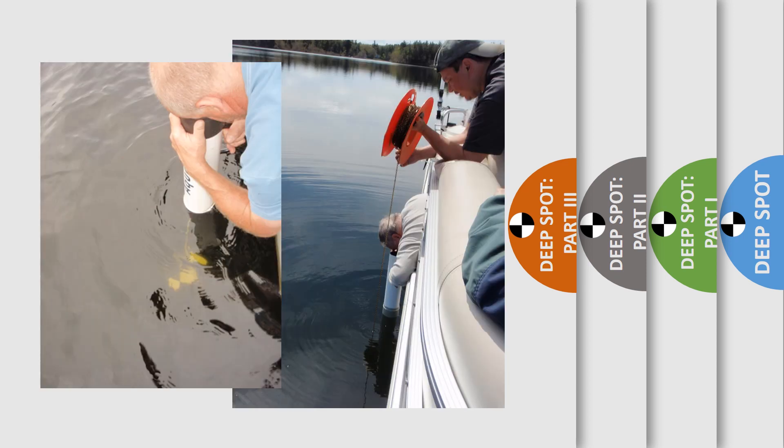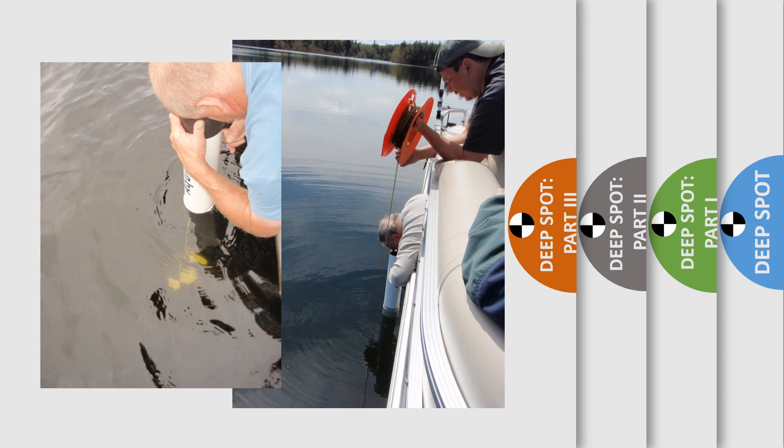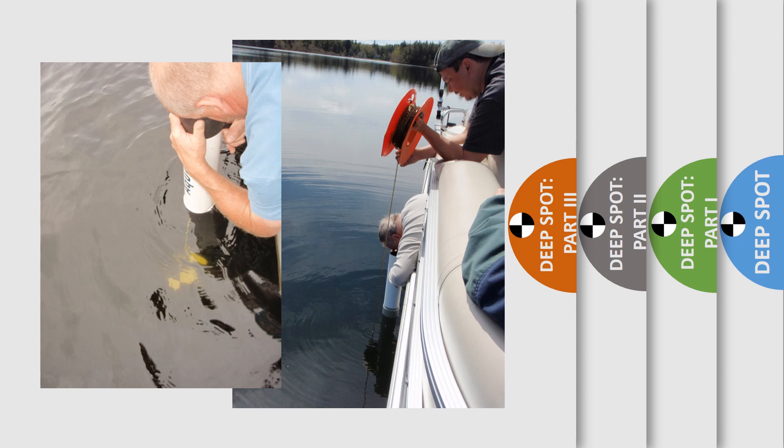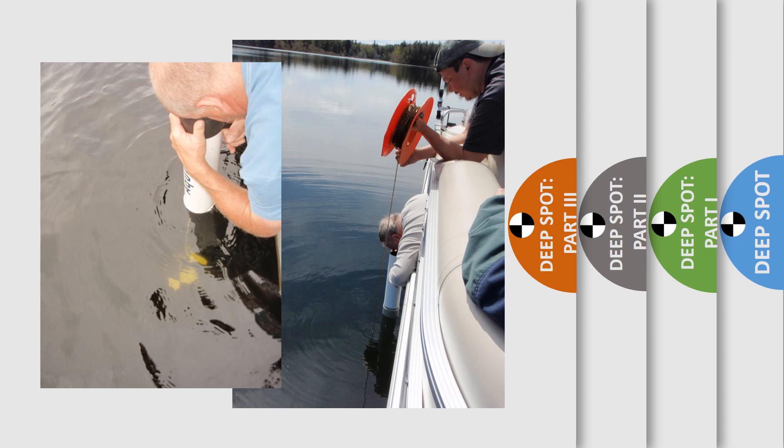Move to the sunny side of the boat to use the viewscope. Put the end of the viewscope in the water and make sure there are no air bubbles and that the end of the scope doesn't leak. Repeat the above process, viewing the Secchi disk through the scope. Record the depths on your field data sheet.